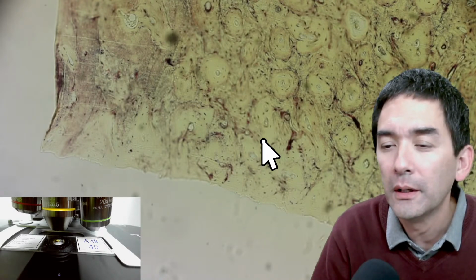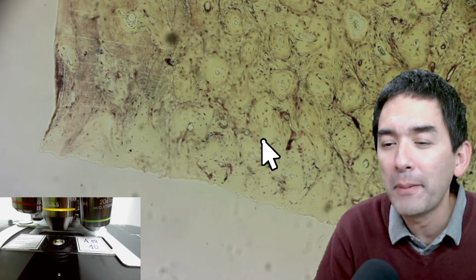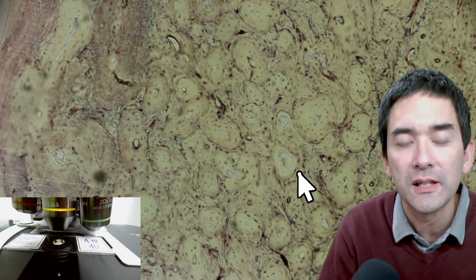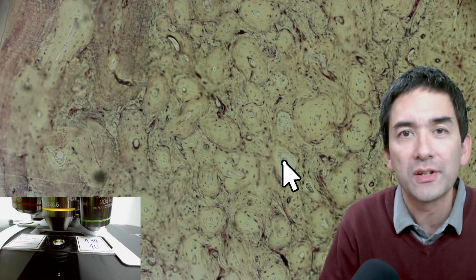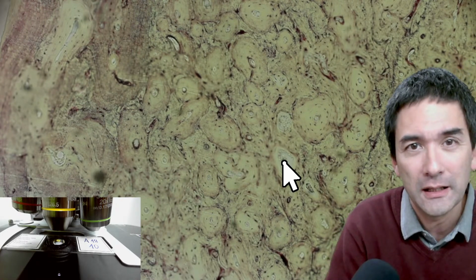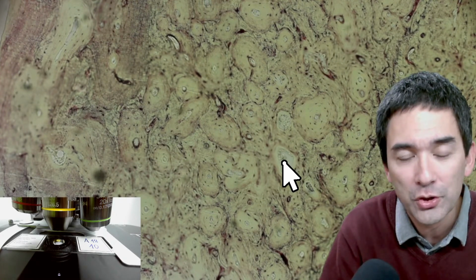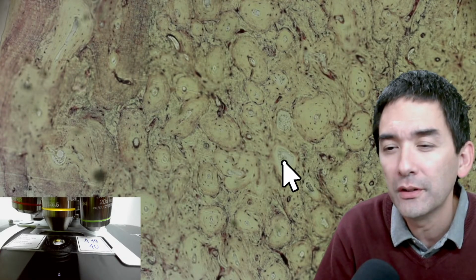Occasionally I look over how similar to a tree it looks. Nature seems to have a pattern. Well, I would say there are certain analogies and similarities, because if you want to transport, let's say, water or nutrients inside a plant, then of course you also need canals. And there are certain physical laws that apply to all living things, and which maybe also determine the shape of certain structures.